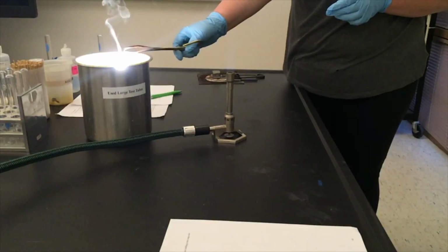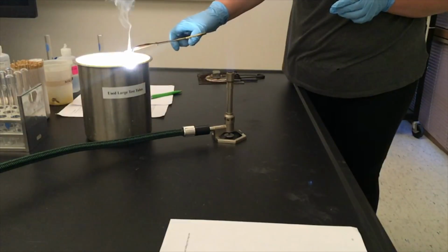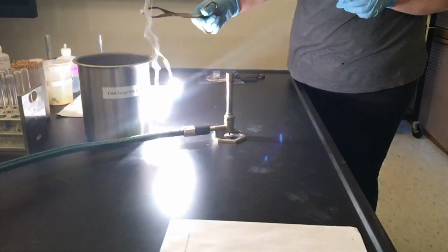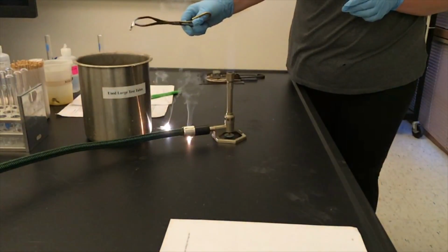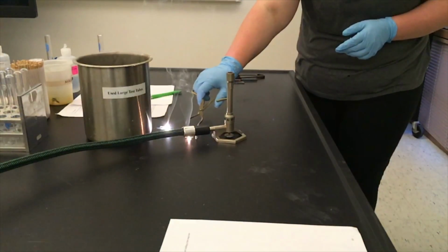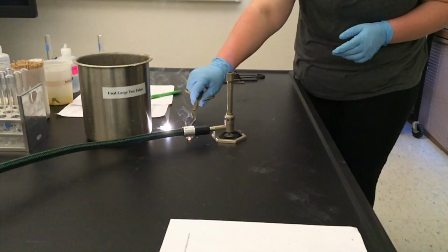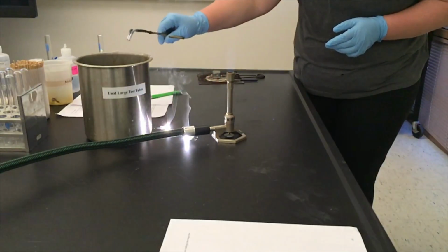When we go and try to pick up some of the magnesium that is dropped onto the lab bench, we will see that it is nearly impossible. The reason is that the magnesium oxide has very different properties from the original strip of magnesium metal. The magnesium oxide is a white powder that is ash-like, and it is nearly impossible to pick up with the crucible tongs.